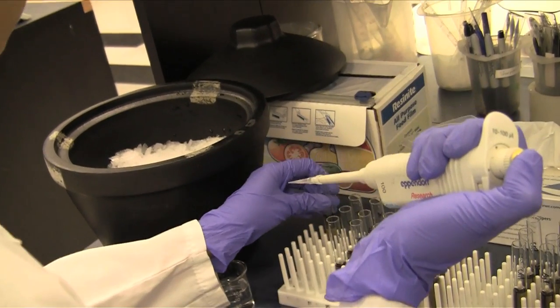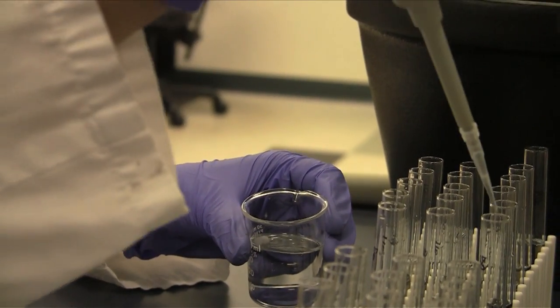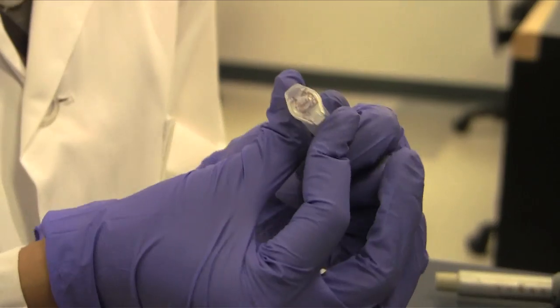Prepare at least two different dilutions of your protein samples in duplicate or triplicate and dilute with PBS. Make sure to record the original volume taken from each of your samples.